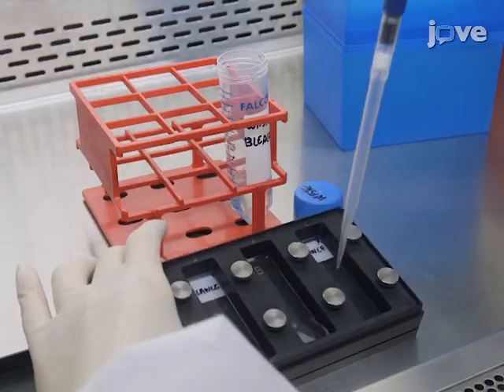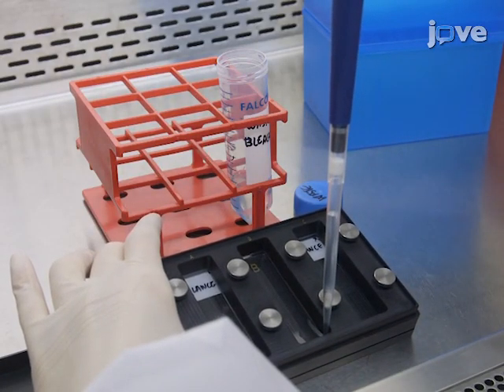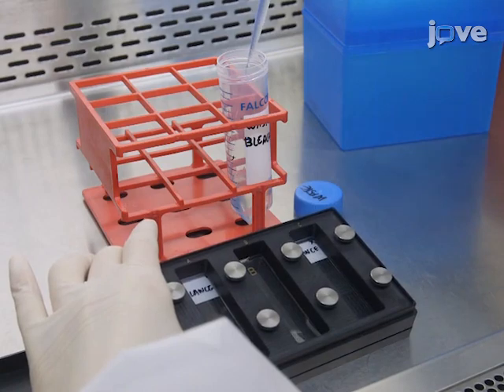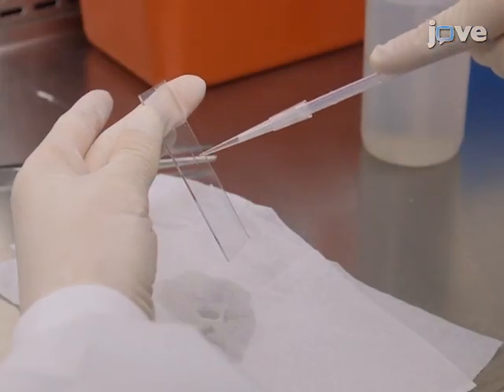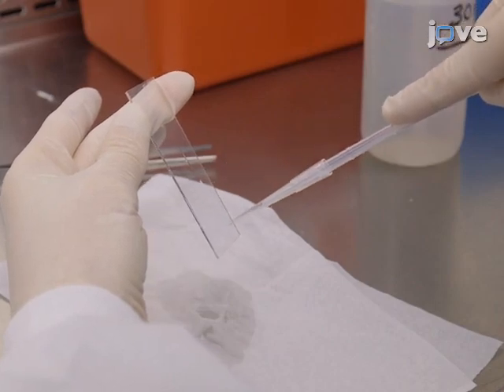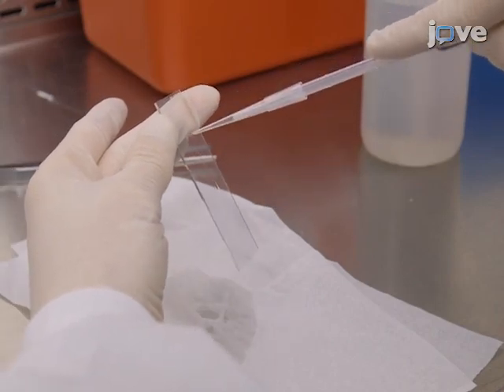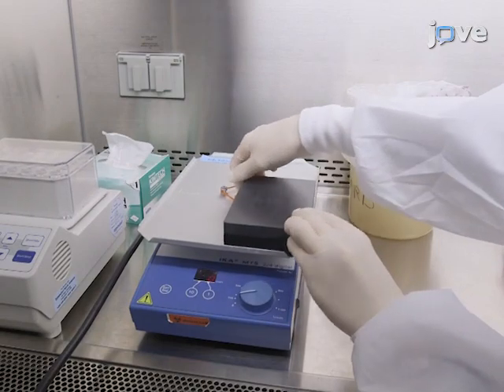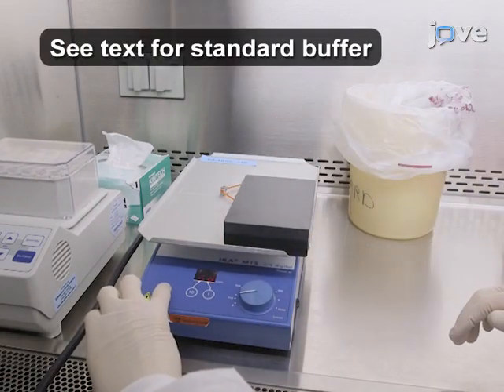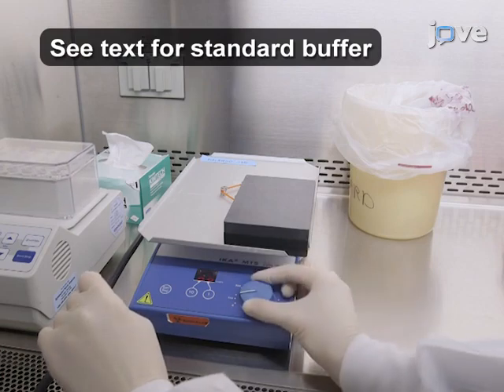Careful handling of the microarray is essential to avoid scratching the microarray surface. Solutions are added to and then removed from the corner of the microarray chamber. Drying the microarray is also important to provide a good scan image. Incubate the microarray with 2000 microliters of standard buffer per microarray for 15 minutes at room temperature on an orbital shaker at 140 RPM.